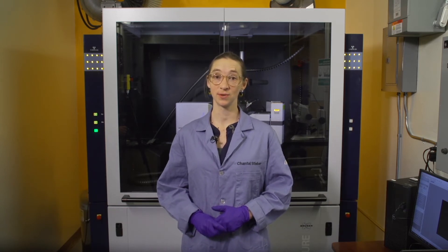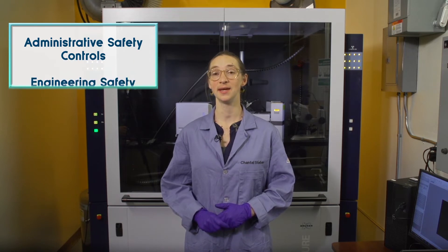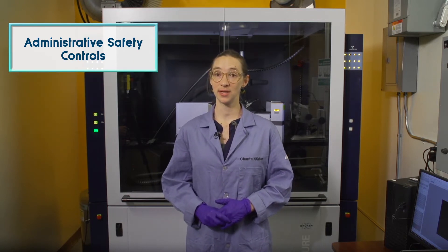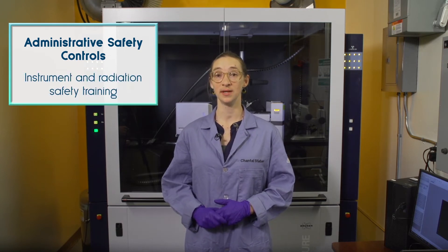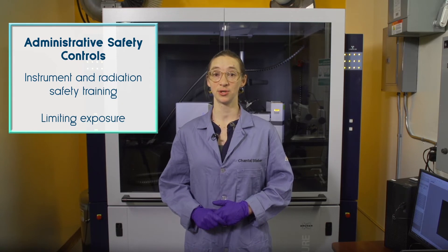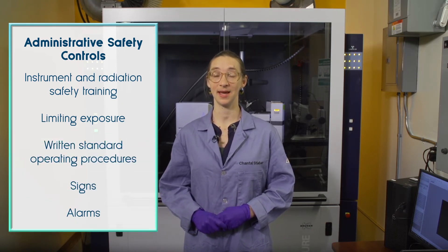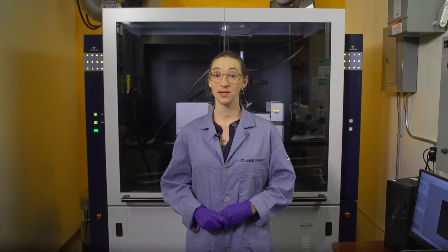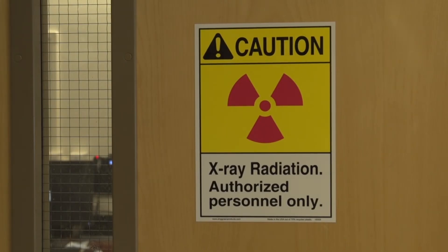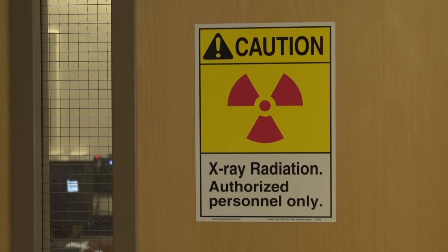Two types of safety controls are highlighted here: administrative safety controls and engineering safety controls. Examples of administrative safety controls include instrument and radiation safety training, limiting exposure, written standard operating procedures, signs, and alarms. Notice the trefoil sign on the outside door of the lab — this sign notifies you that a radiation source is behind the door.